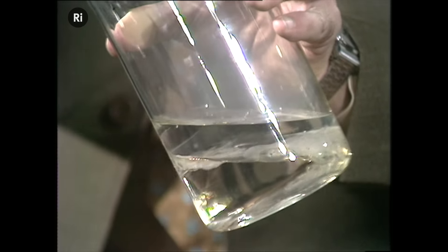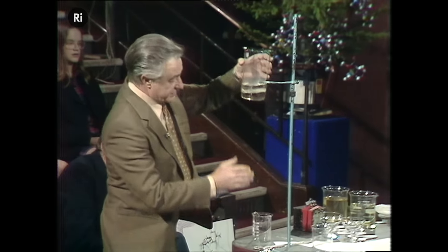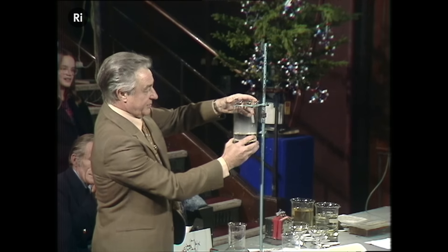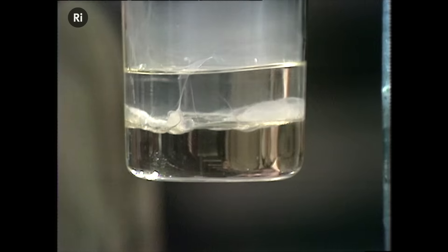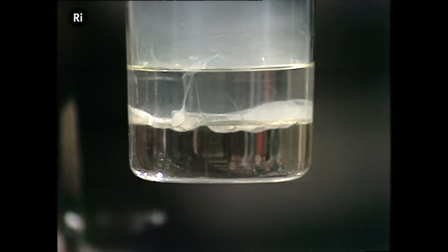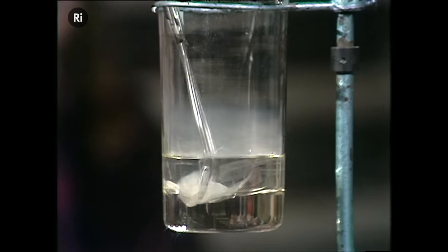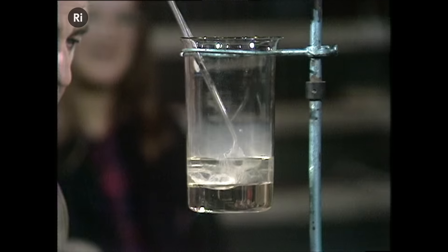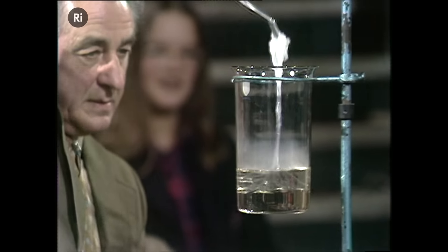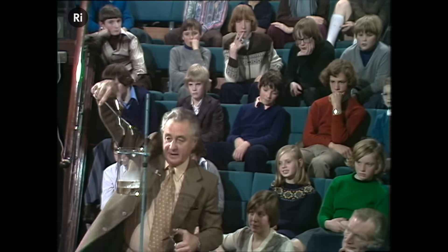And you can probably also see some goo has been formed. Can you see some goo? Right. Well, let's just pull out a bit of that goo. Like this. I'll pull the goo out, some of it, and a bit more.